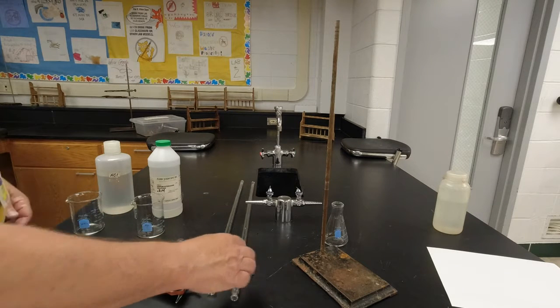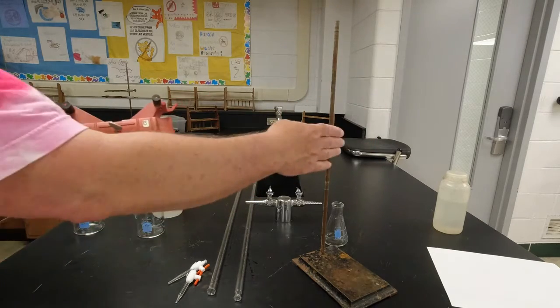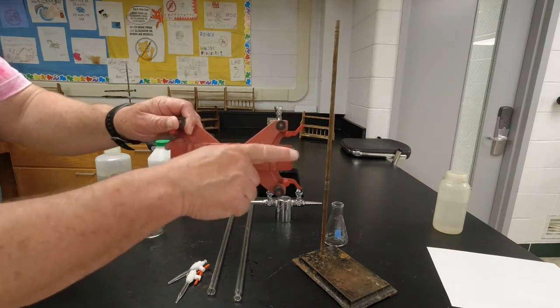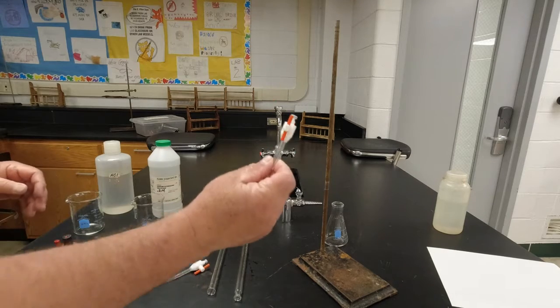All right, I need something to hold them in. This is called a burette clamp. So I'm going to clamp this to my ring stand, and I'm going to put the acid on the left hand side and the base on the right hand side, A, B. So it's kind of in alphabetical order, reading left to right. And then I have these 2 little valves here.